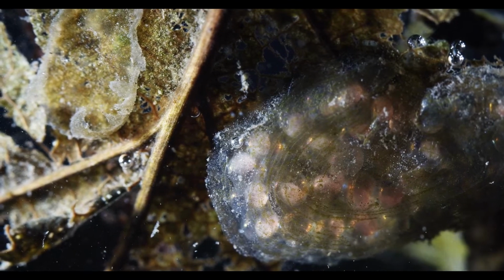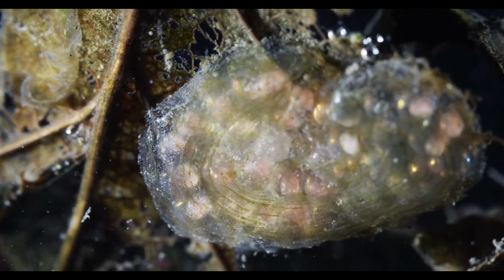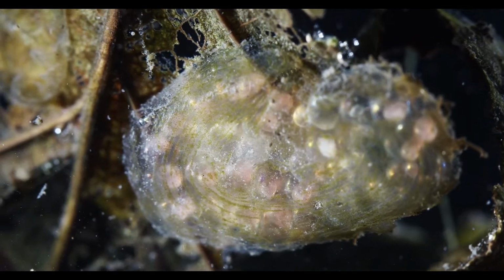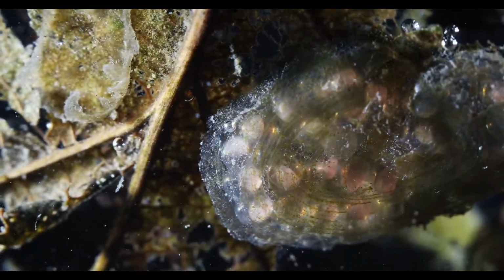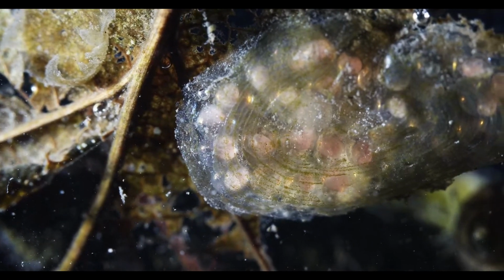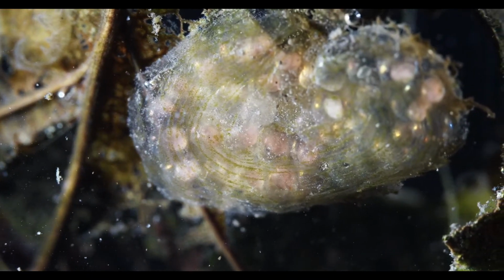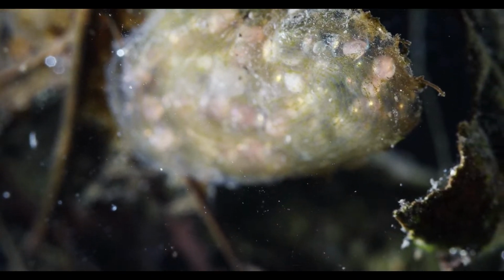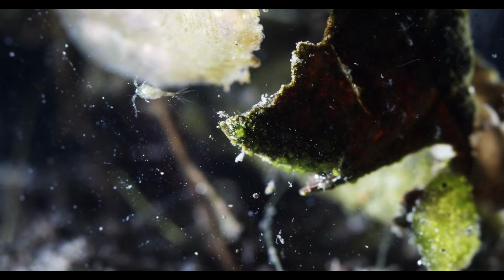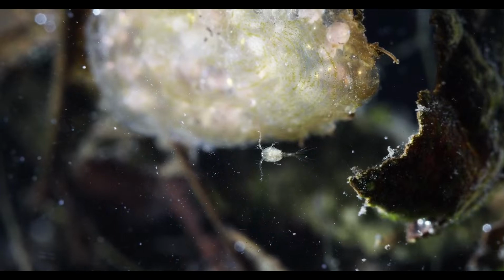For amphibian eggs, I think it's too small. It might be 4 or 5 millimeters across, seeing as the field of view is about 7 or 8 millimeters. Definitely see some movement in there. So I'll see if they hatch. They seem fairly well developed. See if and when they hatch, what comes out of them. Yeah, there's a copepod, not as big as some other ones that are in here.